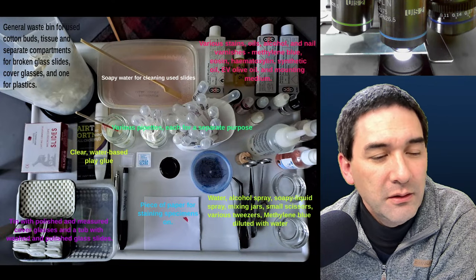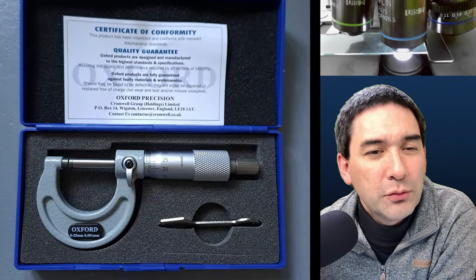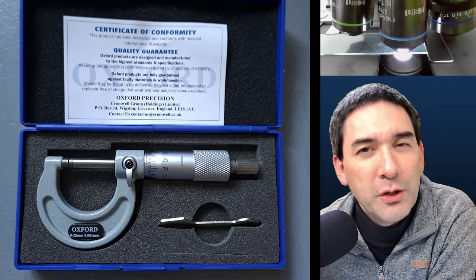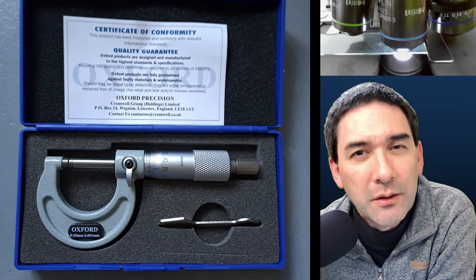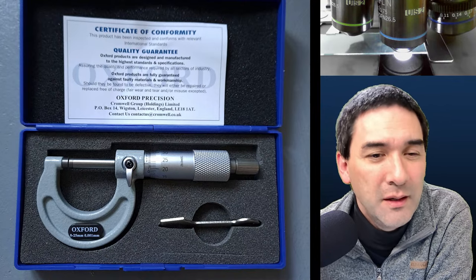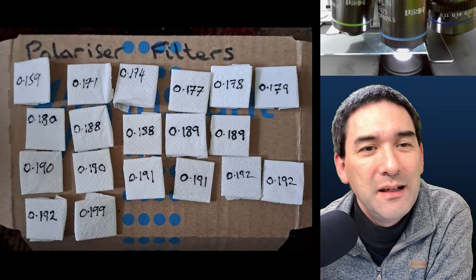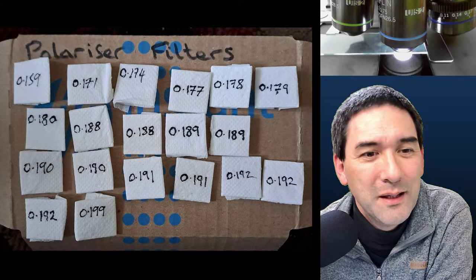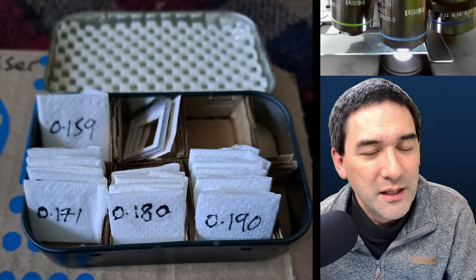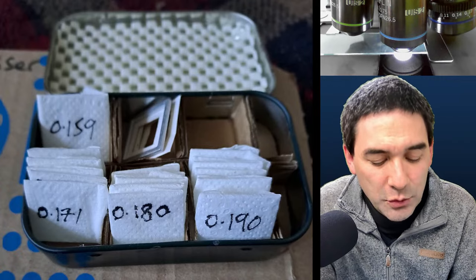I also want to show you a micrometer — a precision measuring device that measures to one one-thousandth of a millimeter, basically the size of a bacterium. I'm using it to measure the thickness of cover glasses, which is something I'd like to talk a little bit about.